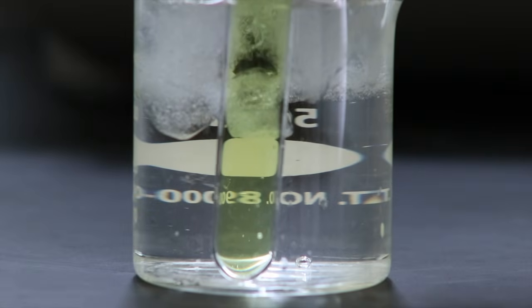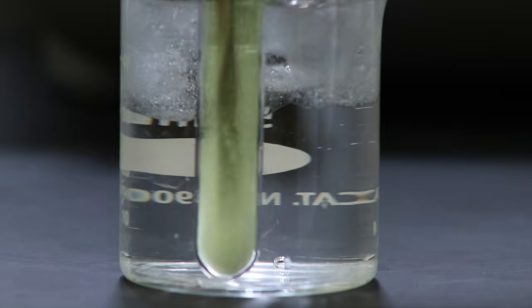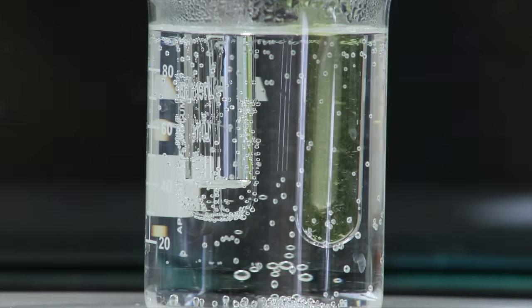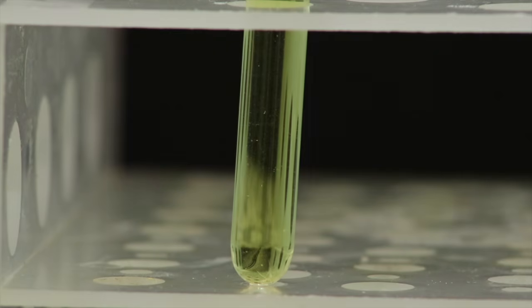Then I'll test that the product can come out of solution in an ice bath, and I was having a little bit of trouble. I had to scrape the sides of the glass with a spatula, so when I put it back in the hot water bath to dissolve the product, I ended up evaporating some of the solvent off. And now I'll leave the solution out at room temperature so that the product can recrystallize slowly.